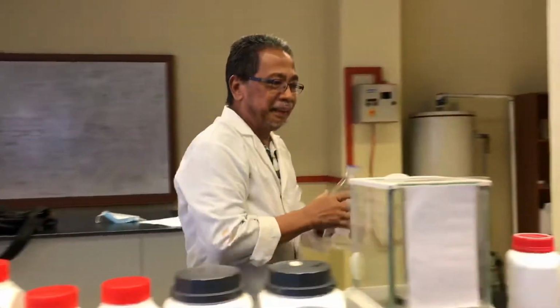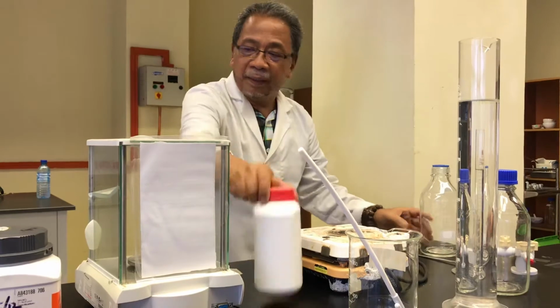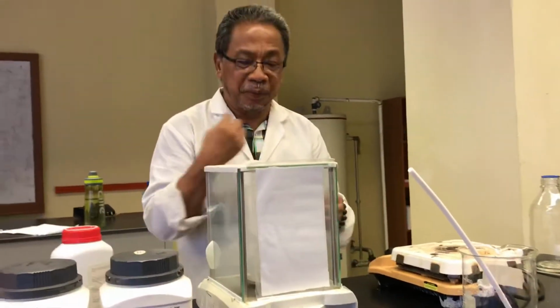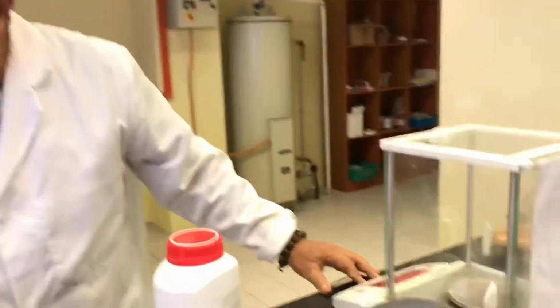Actually, for the NA, you don't have to stir with heating. So they say 5 grams to 200.